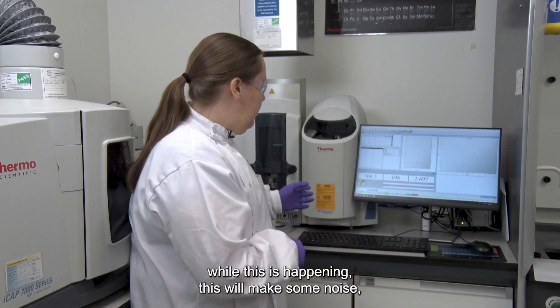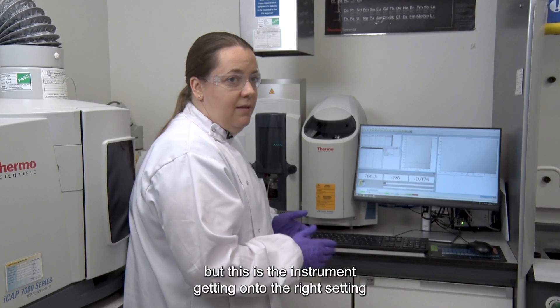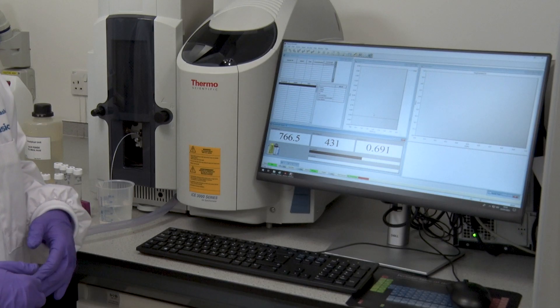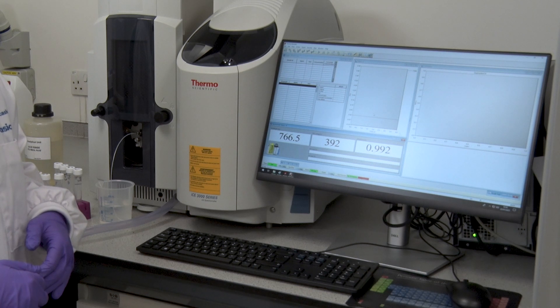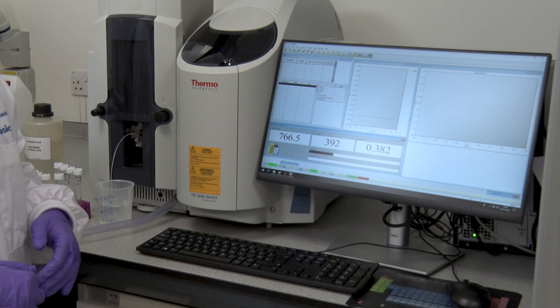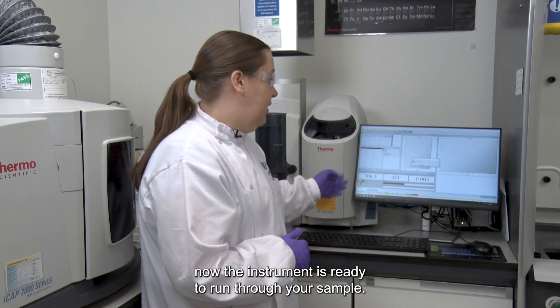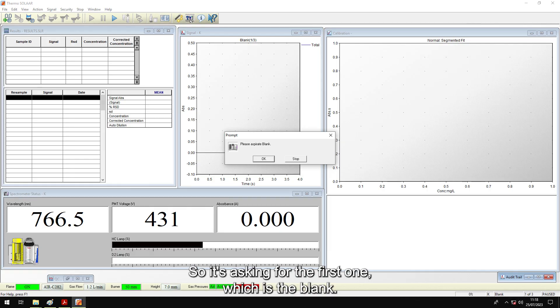While this is happening the instrument will make some noise — this is the instrument getting onto the right setting. Now the instrument is ready to run through your samples, and it's asking for the first one, which is the blank.